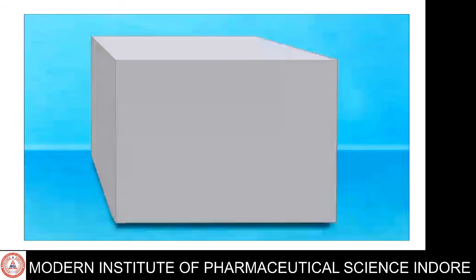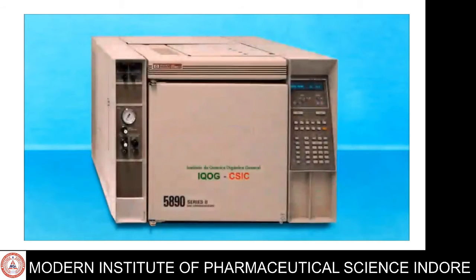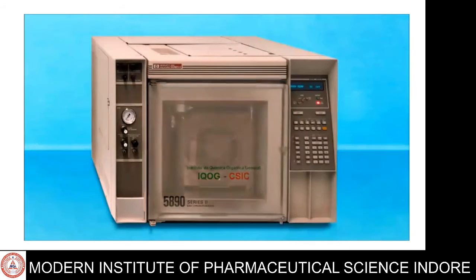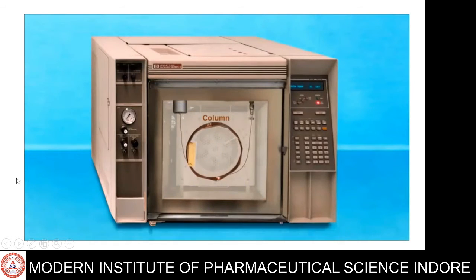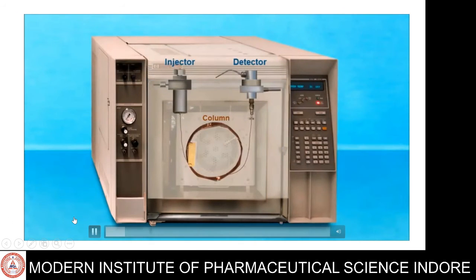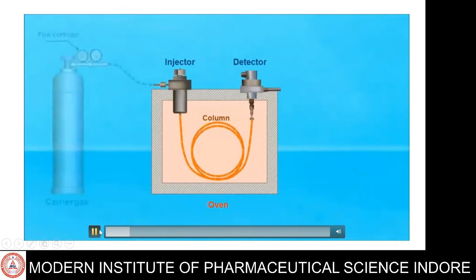So here is the video of gas chromatographic system, how to perform gas chromatography. Oven is attached, which has the separation column. The heart of the gas chromatography is the column, which is made up of metal bent in U shape or coil shape, open spiral or flat pancake system. Here the injector is connected, and detector, flow controller, carrier gas.